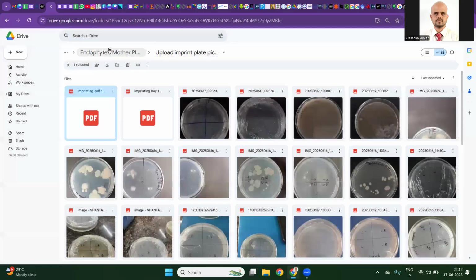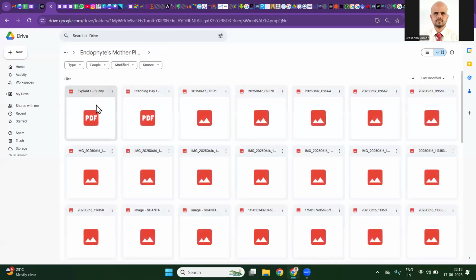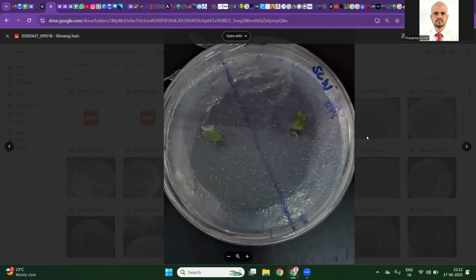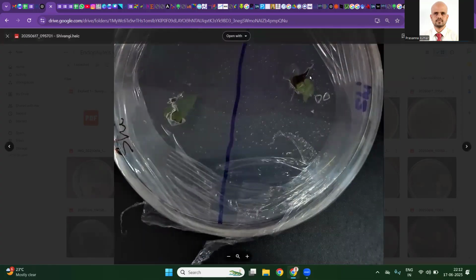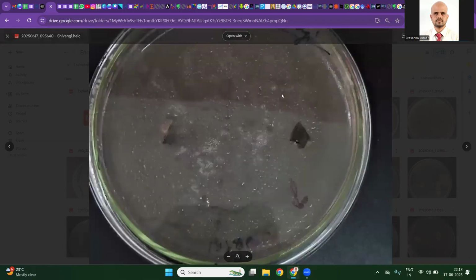We will now examine how the inoculated plates are. Better upload the JPG file, not the PDF. Nothing can be interpreted much because you have water content on the surface of the lid. So this is a reverse plate picture. I can see something maybe coming out. Since the imprint does not have growth, it will be interesting to observe them tomorrow.